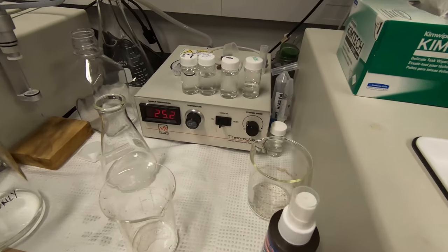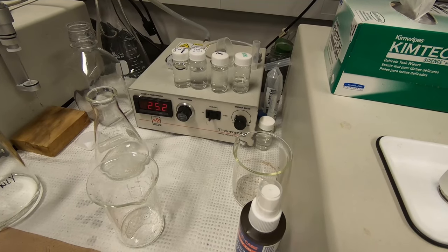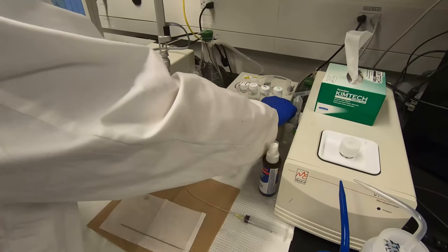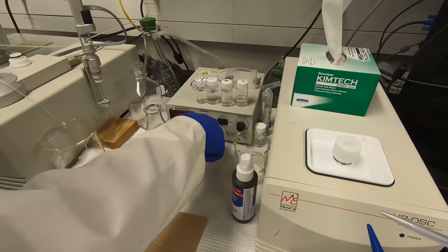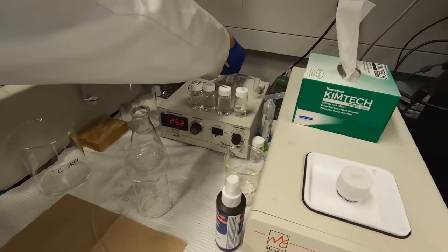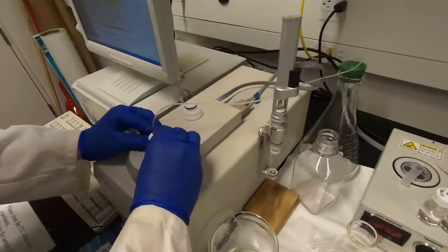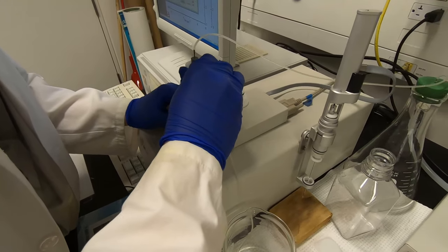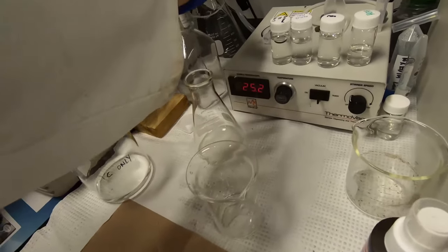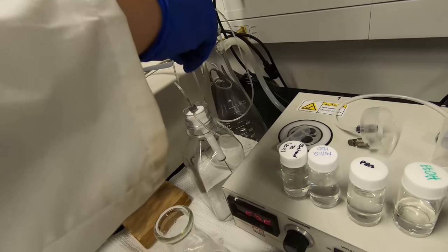The last student who used this has already cleaned it, so I'm not going to continue flushing with water — I'm just doing an example to show you how to do it. I'll just press it to the right side one more time and it will stop. After it stops, just unplug here and here, pull the needle out gently, and store it.